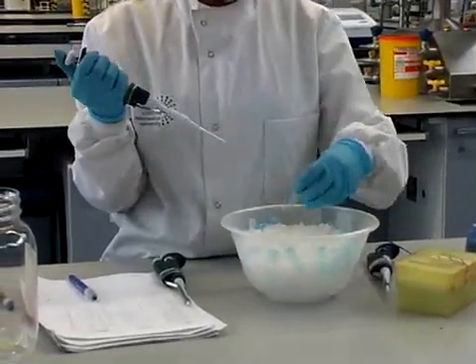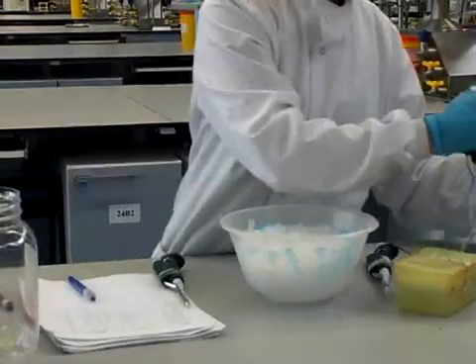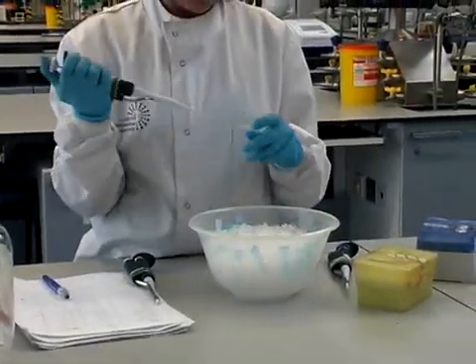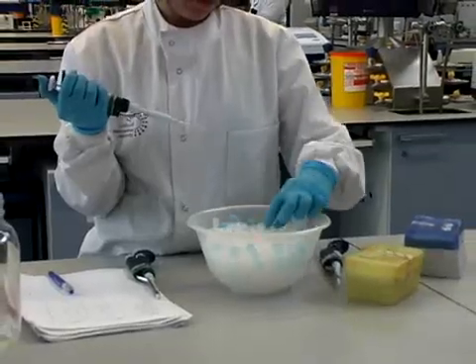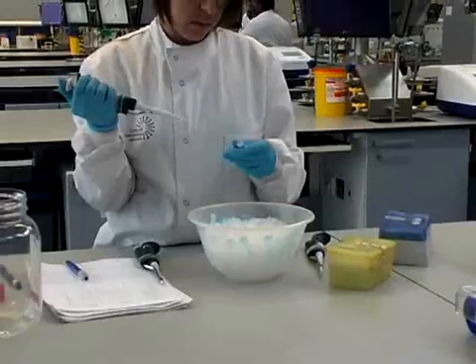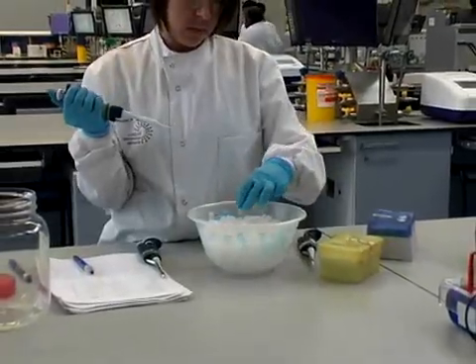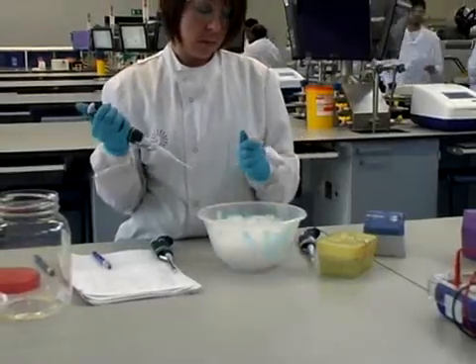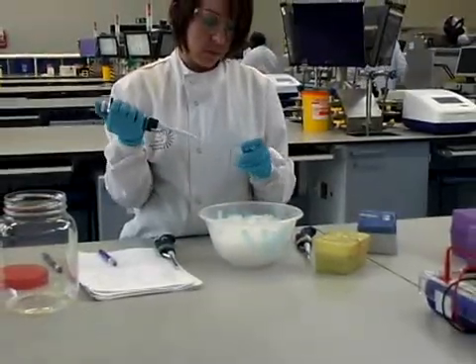And the sample is mixed well with the master mix reagent. Sample three. And a fresh tip is used each time for each new sample.